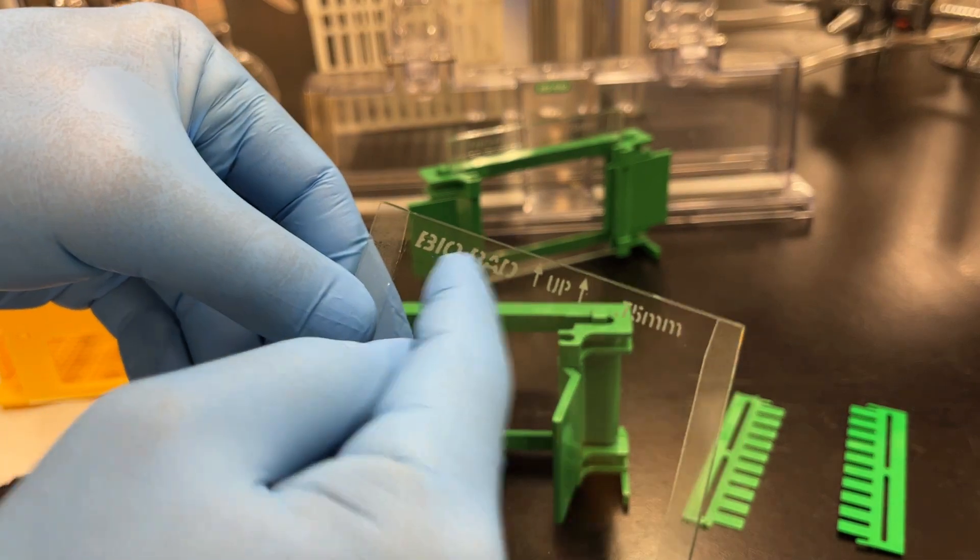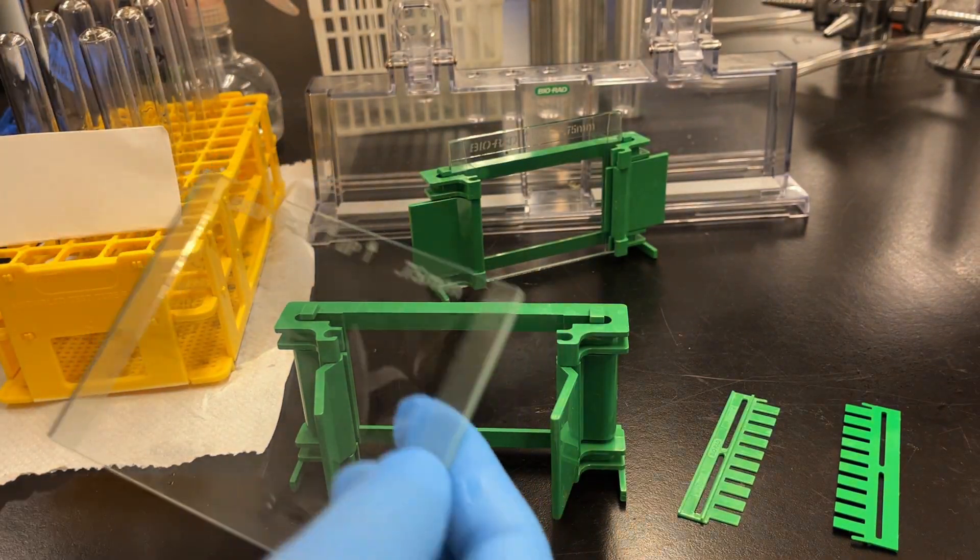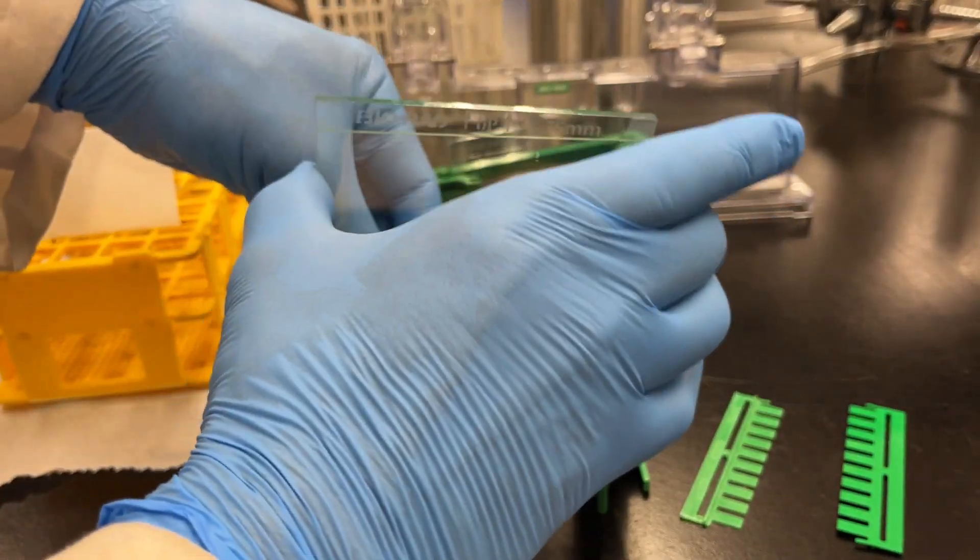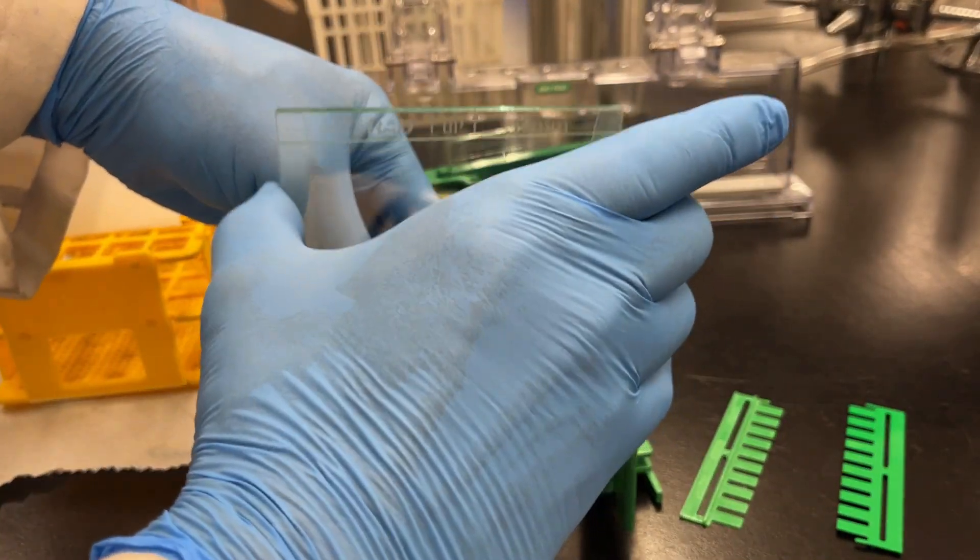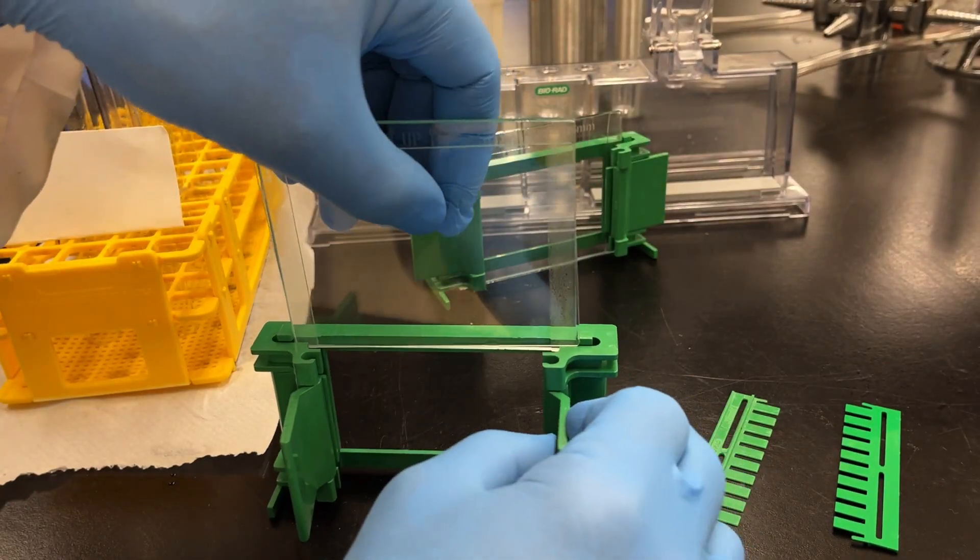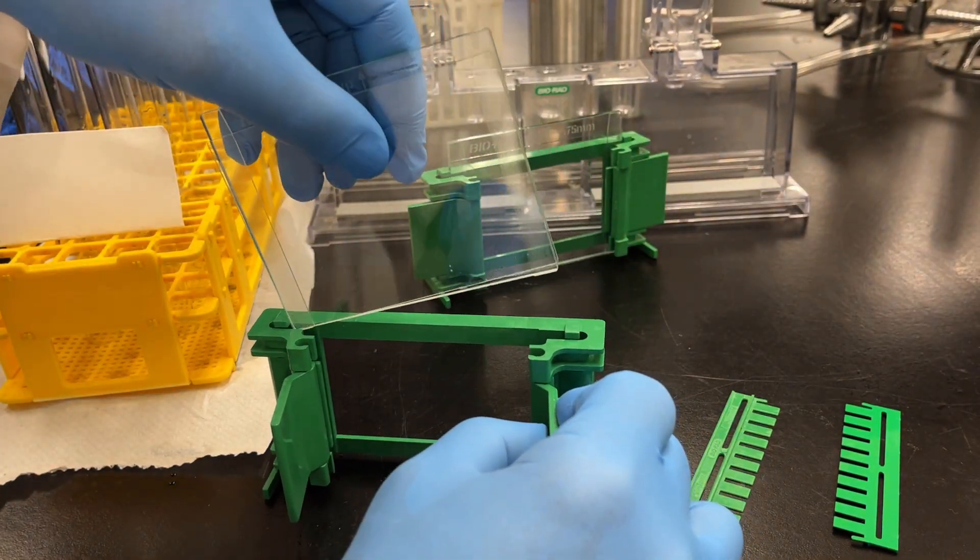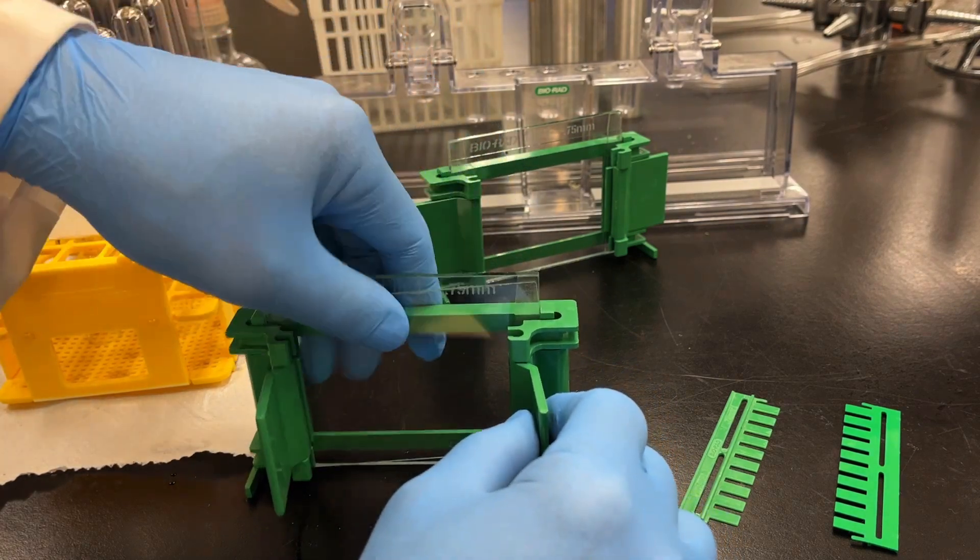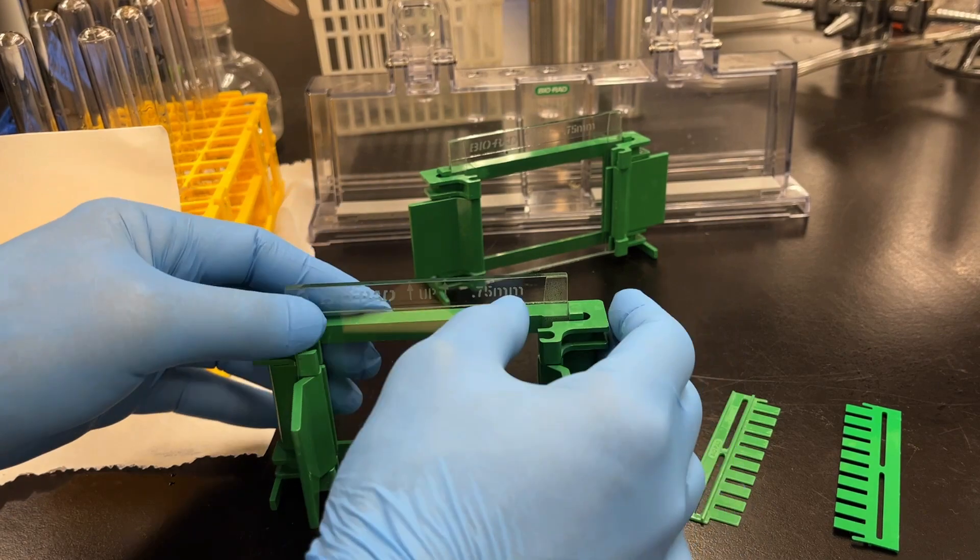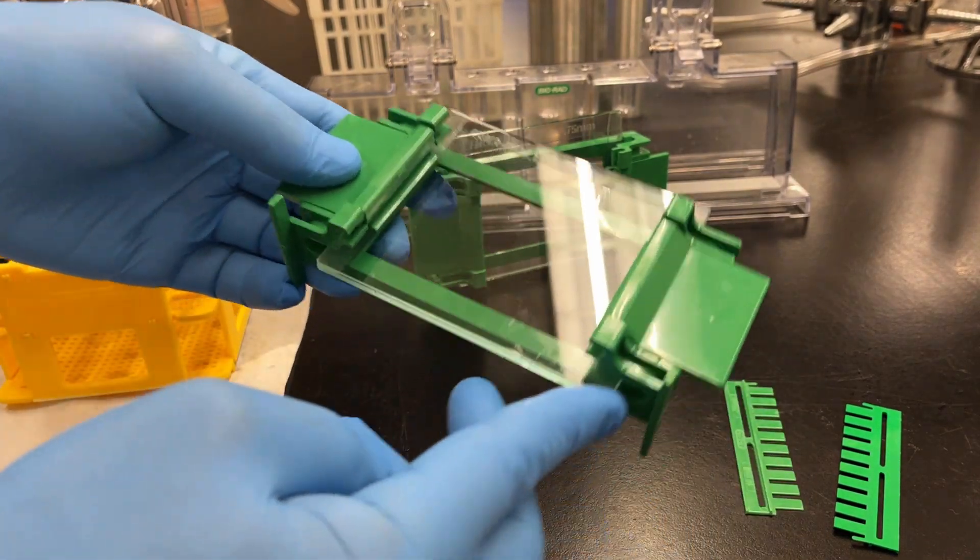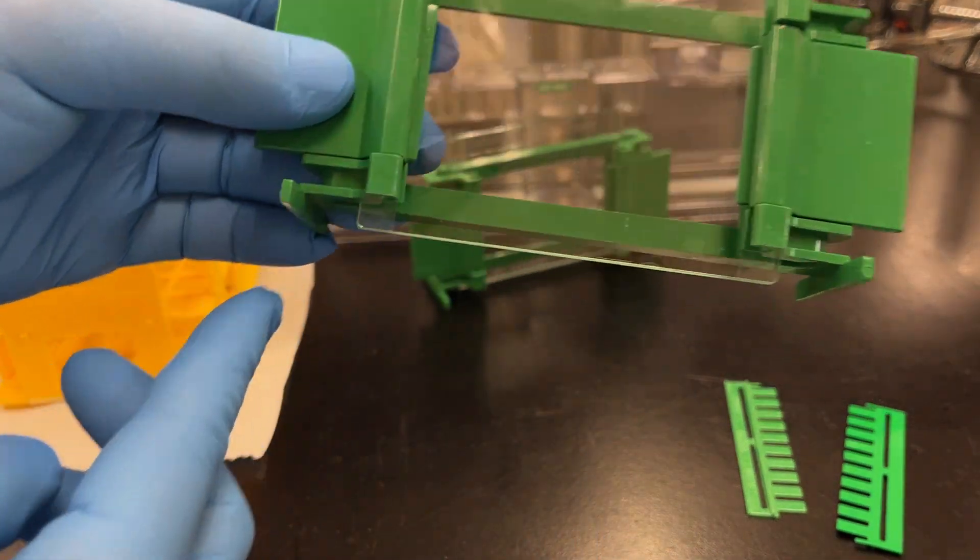Before you watch what I'm about to do, I'll just note that it's much harder to film this while performing this, so something so simple actually turns out to be a little bit more challenging than I anticipated. But I got through it. You don't have to put in both glass plates at the same time. Just make sure, I like to push and give it a snug fit. Make sure that the edges are lined up and everything looks okay.